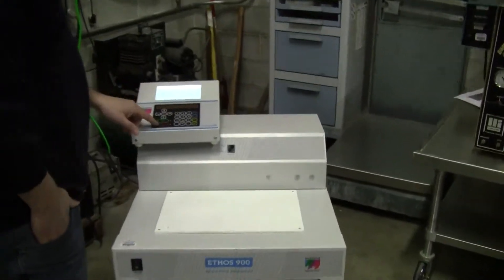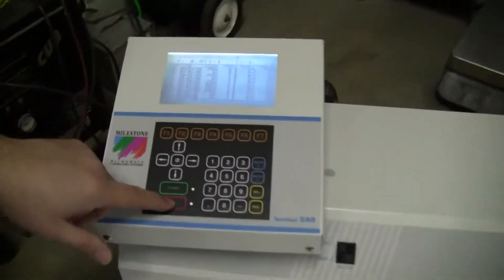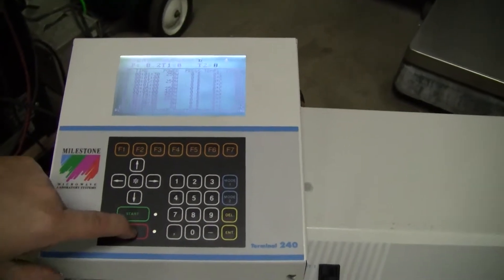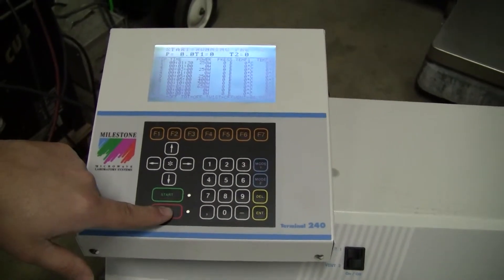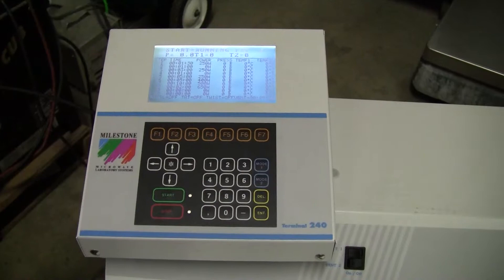We've got an LCD start up here. Stop. User break. Shutting down.